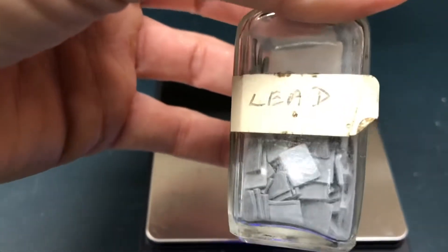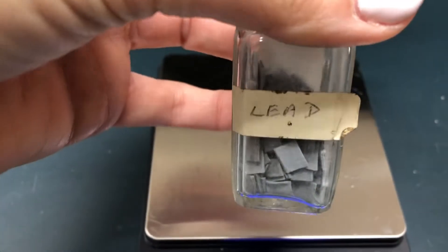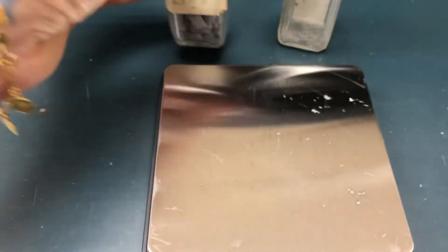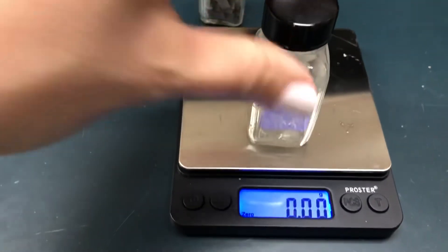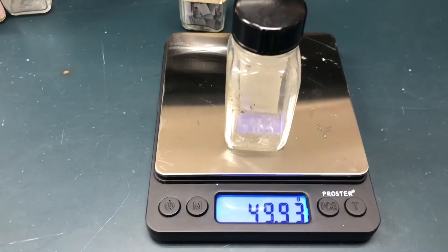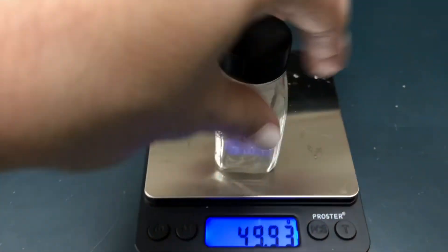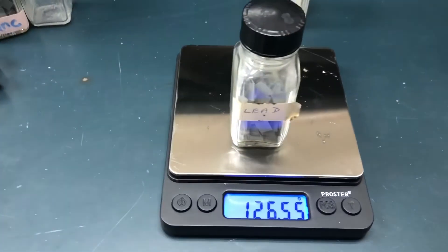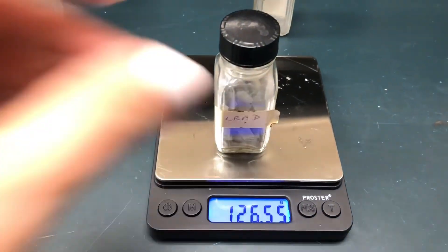You can see the pieces in here — a little bit duller and a little bit more malleable than zinc. Again, an empty bottle, similar to the empty bottle you're going to see the lead in.